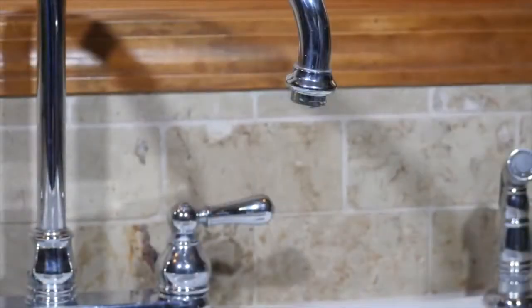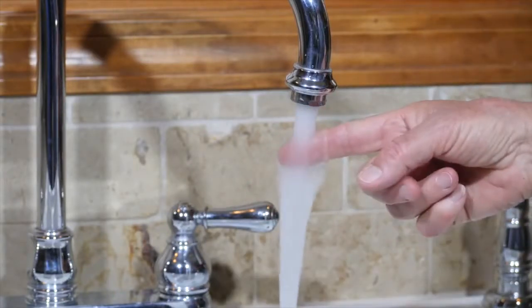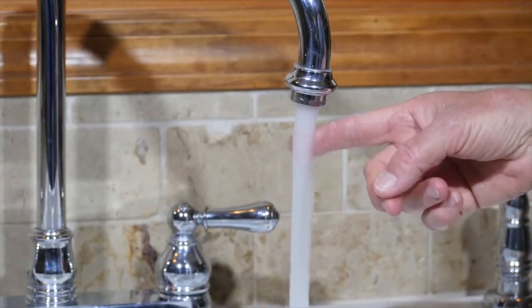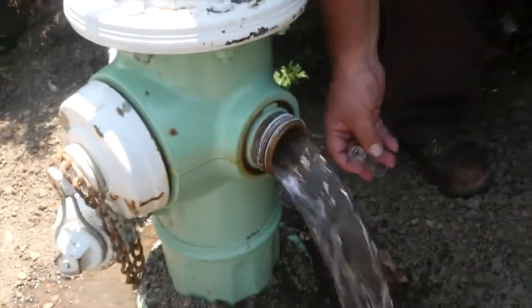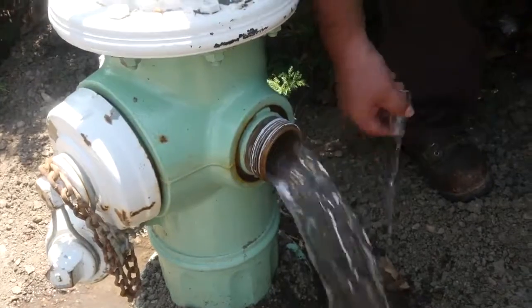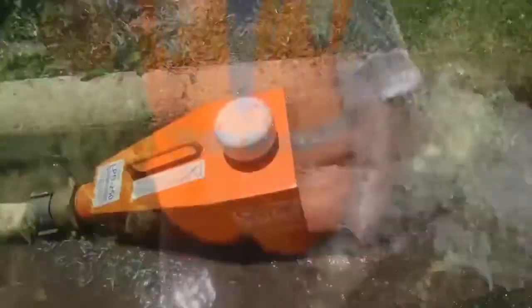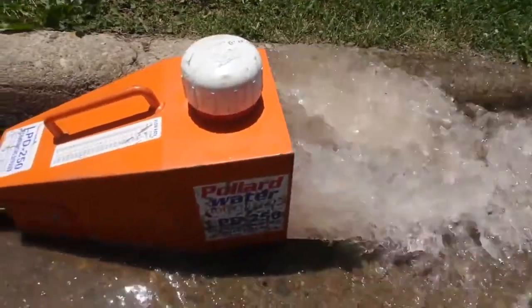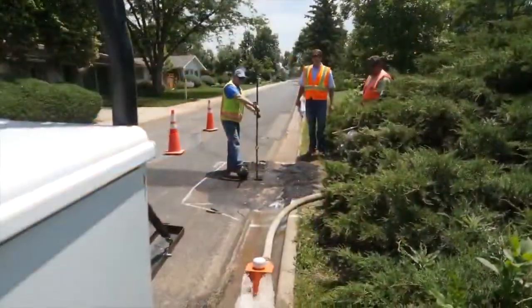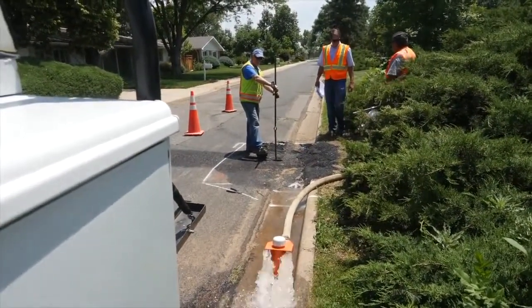The cold water tap is used. The line is flushed until the water is a consistent temperature to ensure that you are drawing water from the main line. Non-compliance samples may be taken to gain information about residual levels in the distribution system. These are typically taken during flushing or investigating customer complaints. The amount of flushing prior to analysis will impact the results.